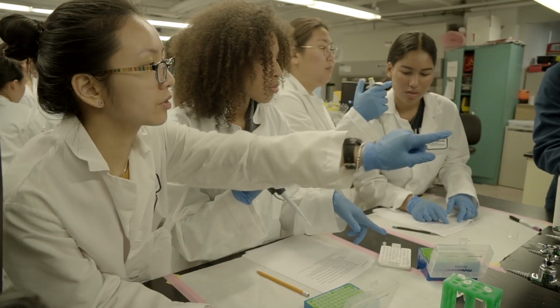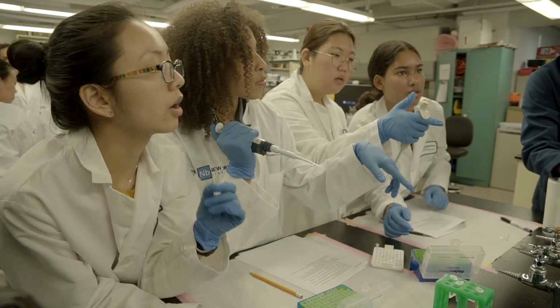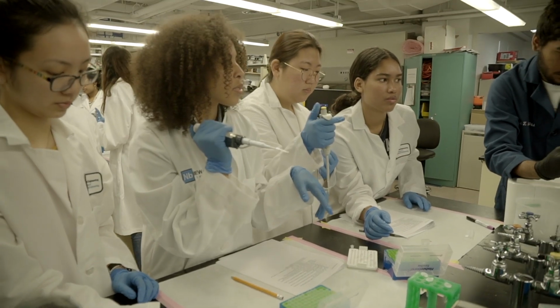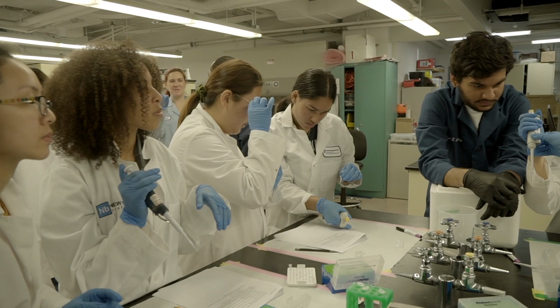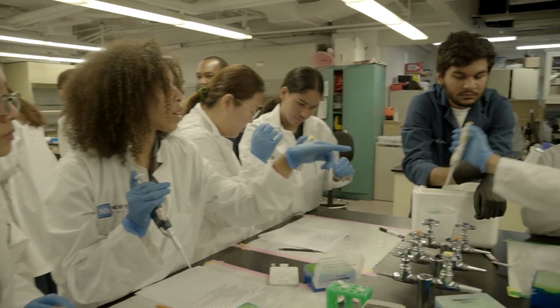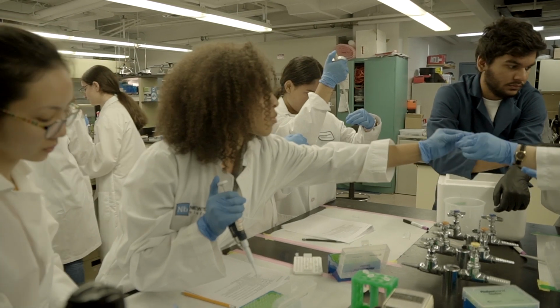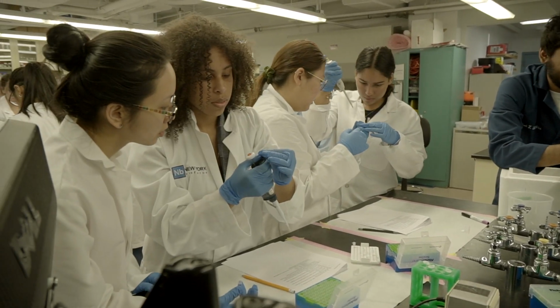Is that 4 over there? Right here. Can we get number 4? Okay. Are you guys ready? Yeah, we're ready. Number 4? We did A, B, C, and X. Okay. Did you have one that says PCR, one that says restriction digest? Yeah. Okay.